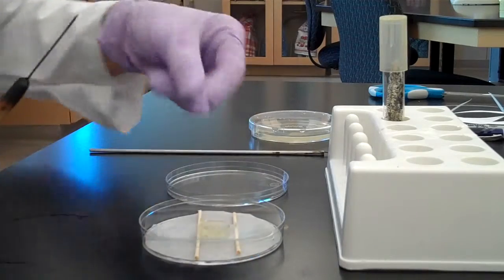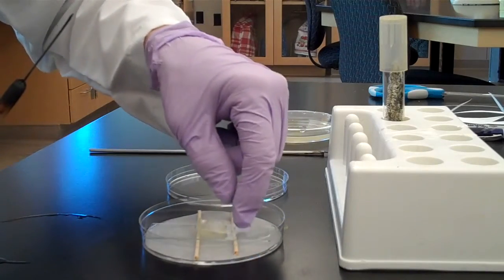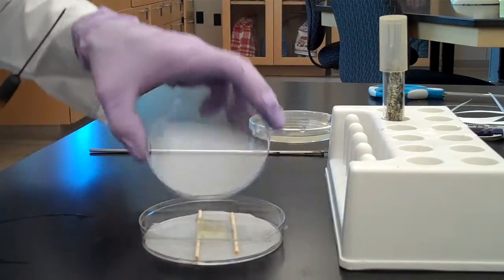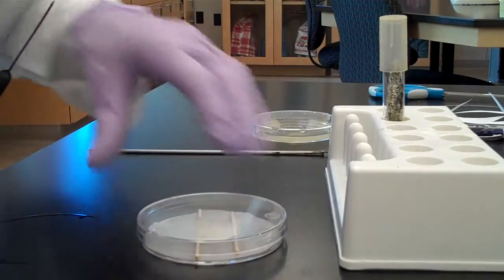Then add your cover slip and your lid. This completes this assignment of the fungi exercise.